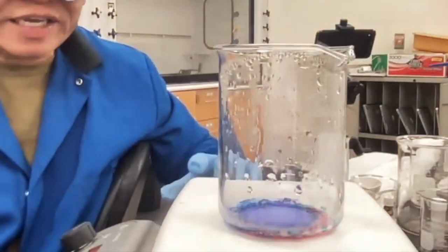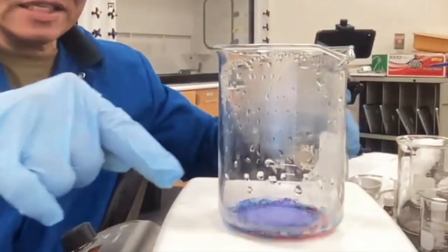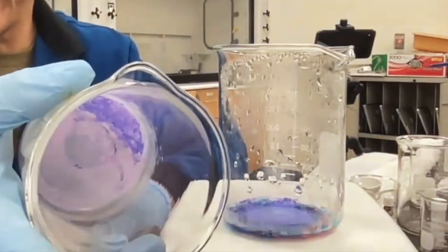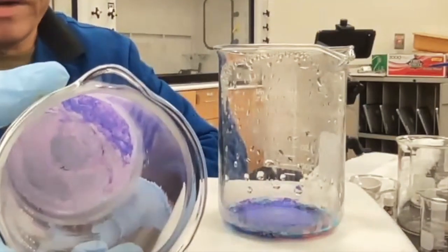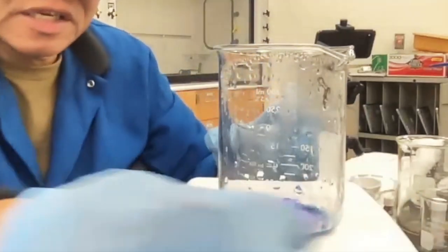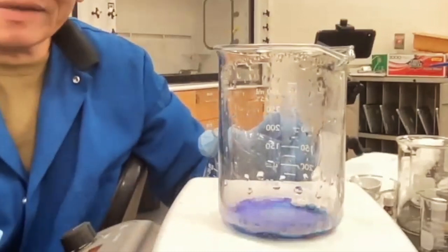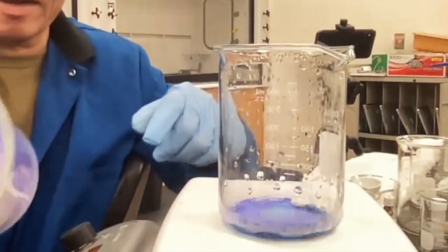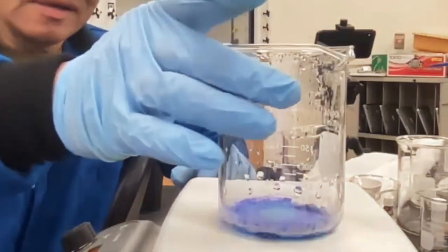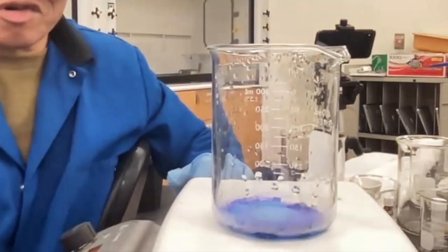So here you can see exactly what's going on. You can see exactly that this is turning into this. Note the color. The edges is powder blue, but then the center is kind of like violet. I don't know. You guys have to describe that color. It's not purple. It's not violet, but you guys can see. You should use yours.